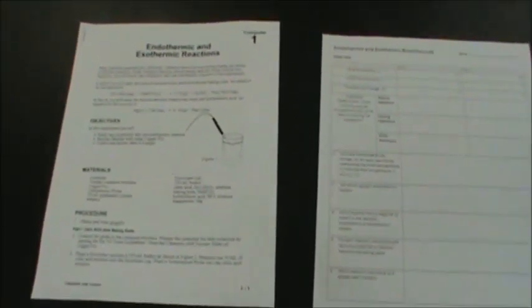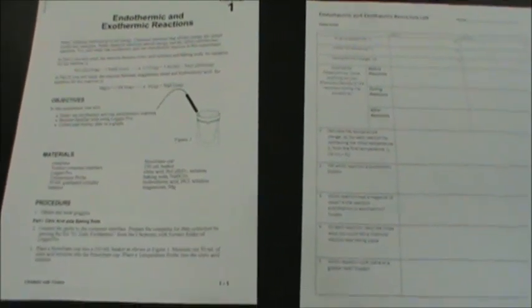This is the endothermic and exothermic chemical reactions lab that you're making up on YouTube. You should have a document already with you at the moment, which is your answer document. This is where you're going to make all your recordings and observations, and also where you do all of your analysis questions at the end — after you've done the entire procedure.